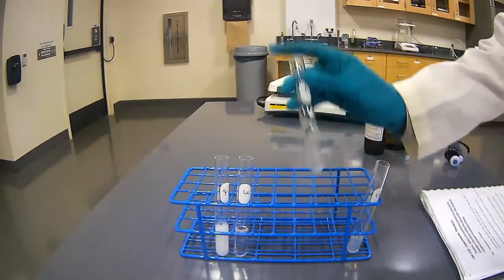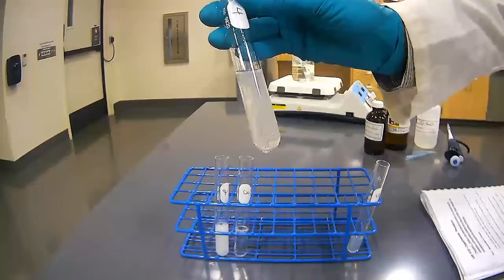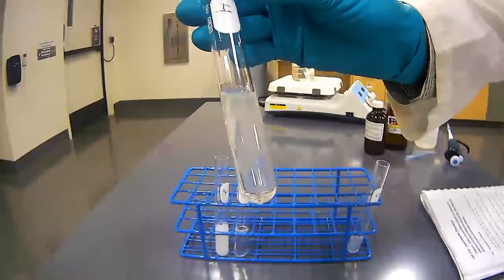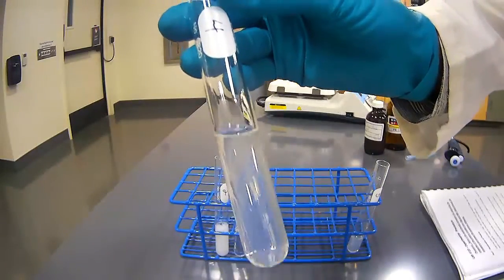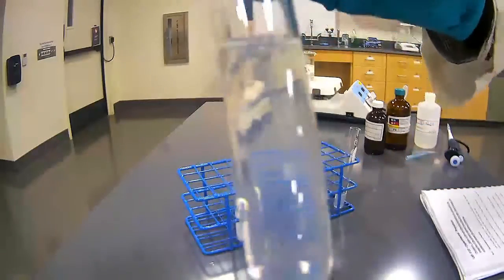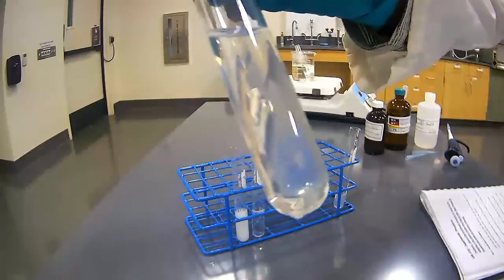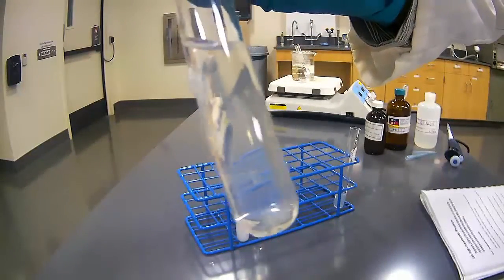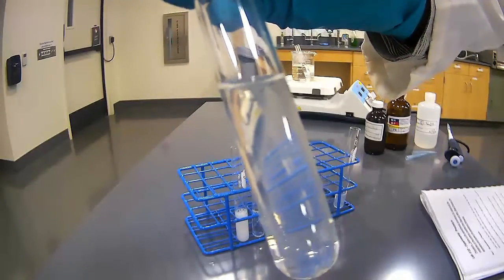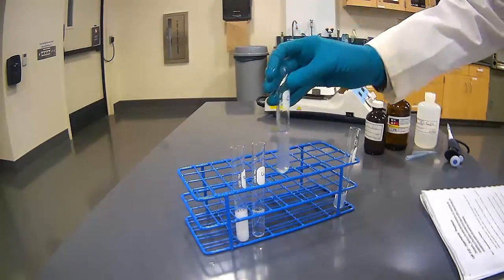Take a look at it. Shake it up. And if you can see within there, hard to see close in the camera, what I'm seeing are bubbles coming up. So some gas was being released from our solution. And from those bubbles, we're getting a relatively clear solution.